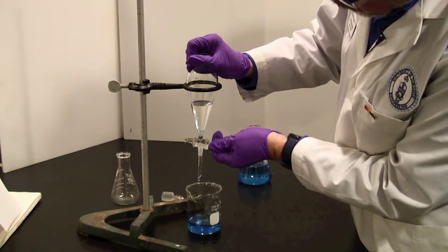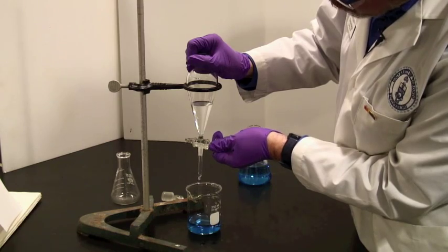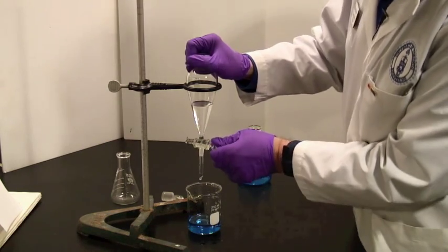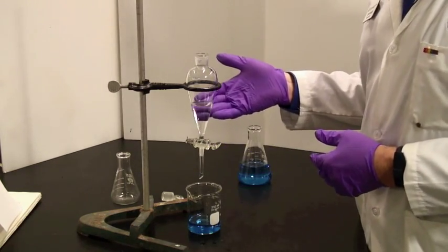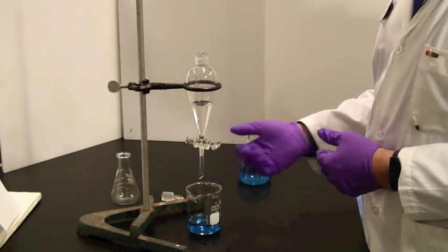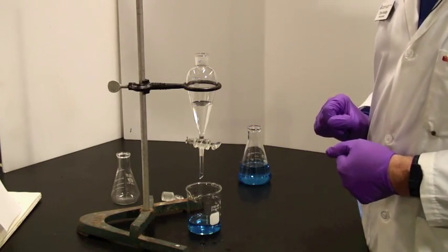You could alternatively be interested in the lower phase, in which case you would have to drain out this upper phase and put the lower phase back into the funnel to wash it.